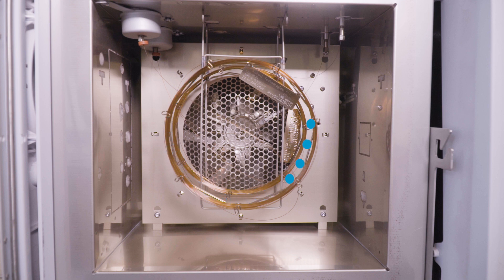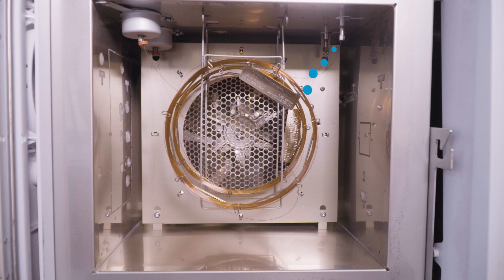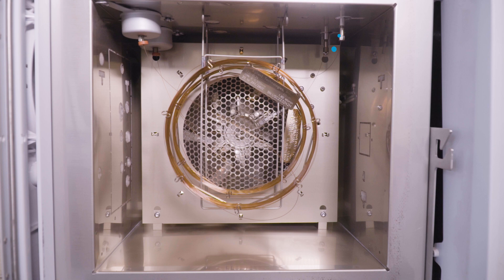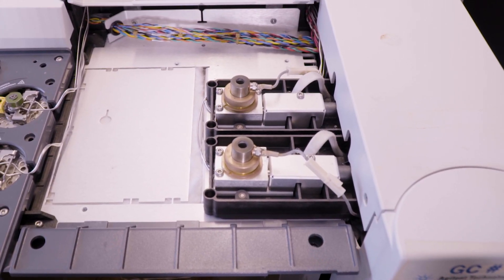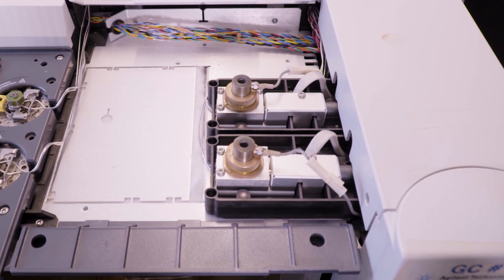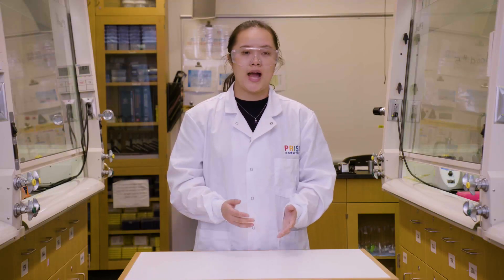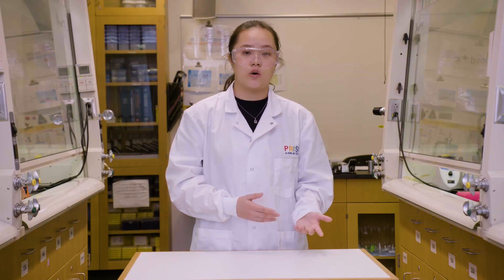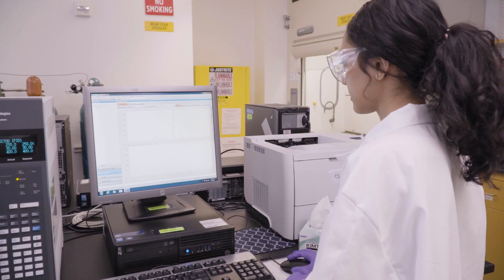At the other end of the capillary column, we have the flame ionization detector. This detector operates by burning hydrogen gas in the air, generating a flame. Organic analytes, when passing through the flame, get ionized, and their signals are recorded on a chart as a chromatogram.